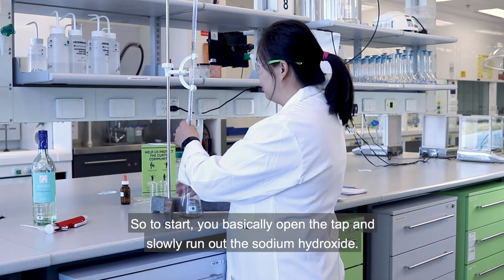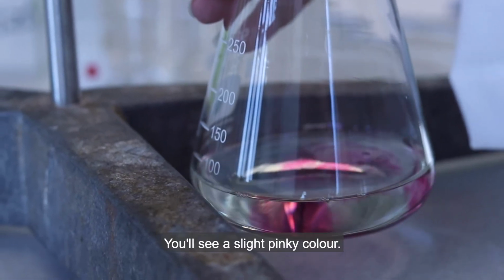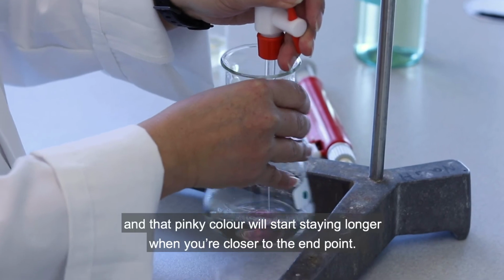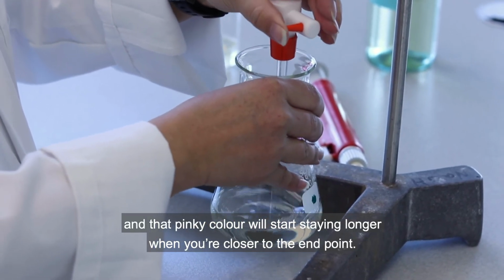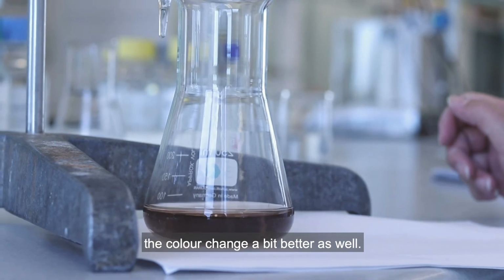So to start, we basically open the tap and slowly run out the sodium hydroxide. You'll see a slight pinky colour. That indicates that there is sodium hydroxide being added, and that pinky colour will start staying longer when you're closer to the end point. If you wanted, you could use a white piece of paper so that you can see the colour change a bit better as well.